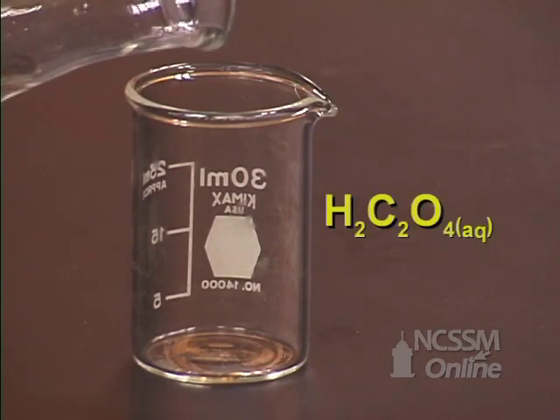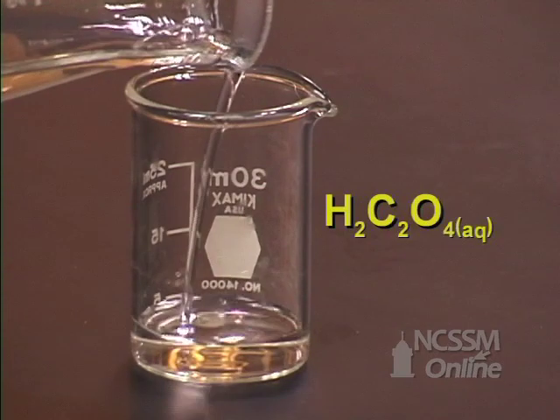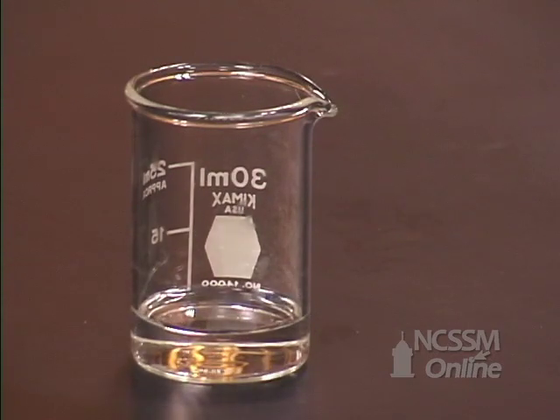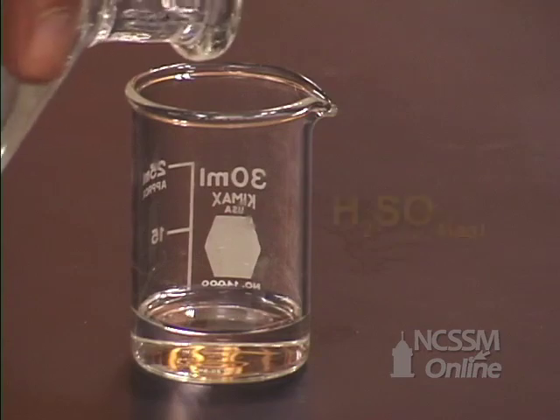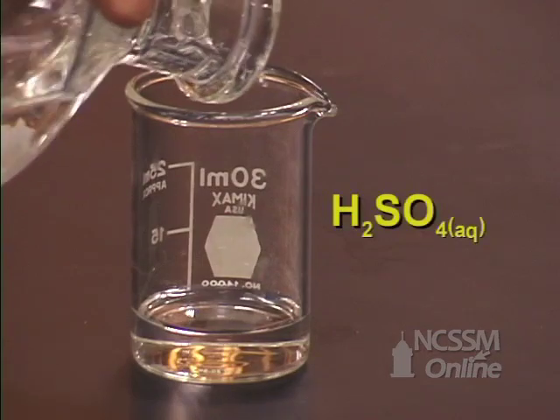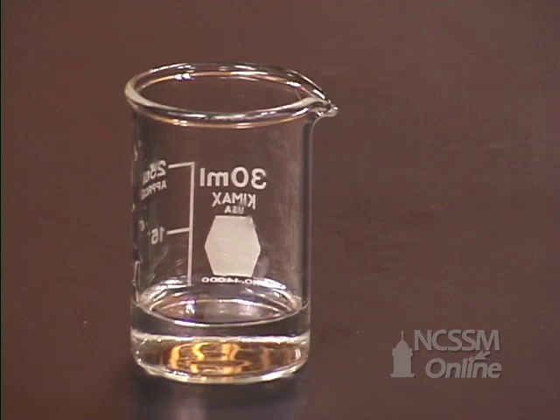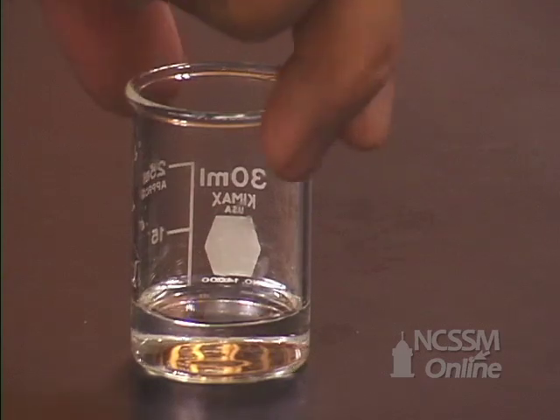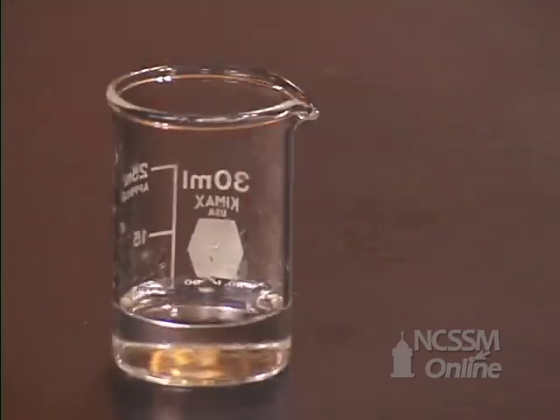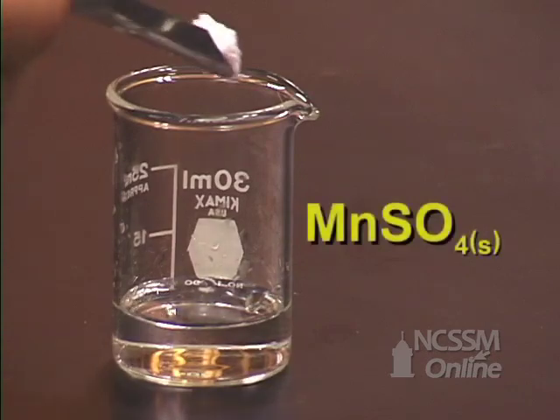We will place some oxalic acid solution in the beaker. We will add a little bit of sulfuric acid. We will then add some manganese sulfate.